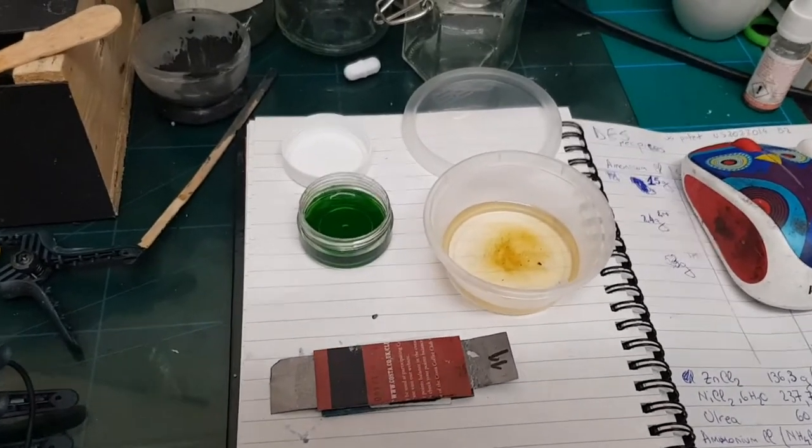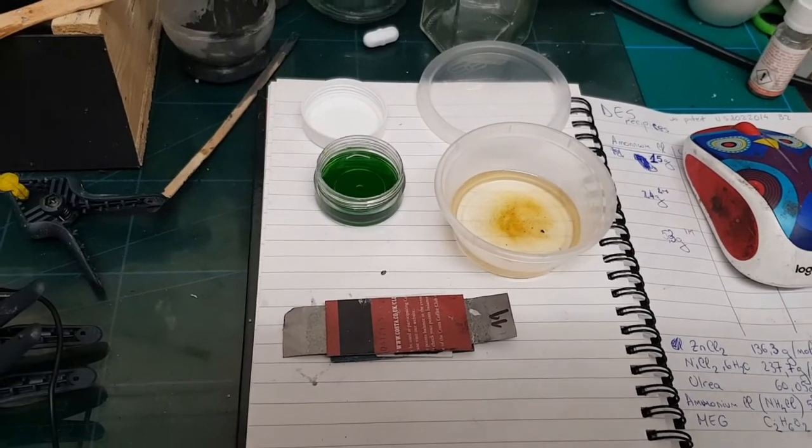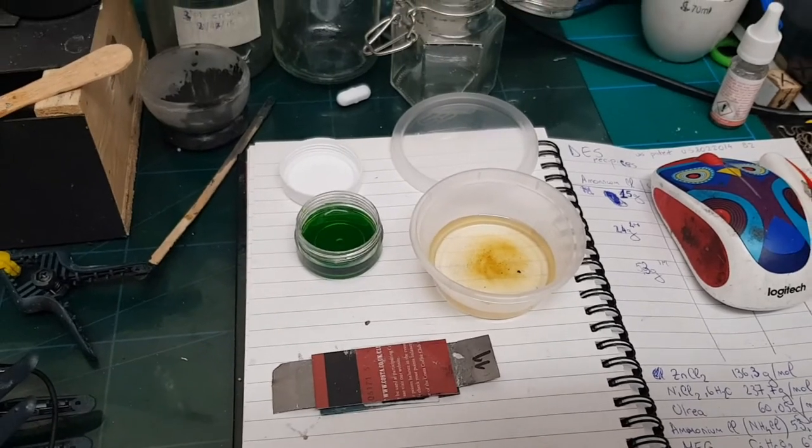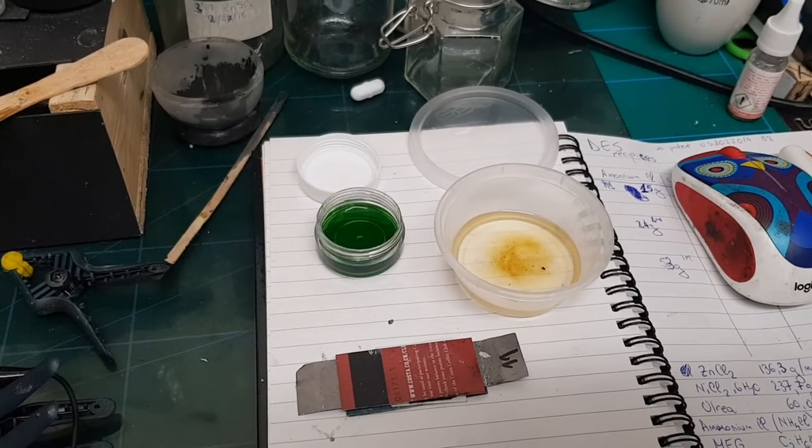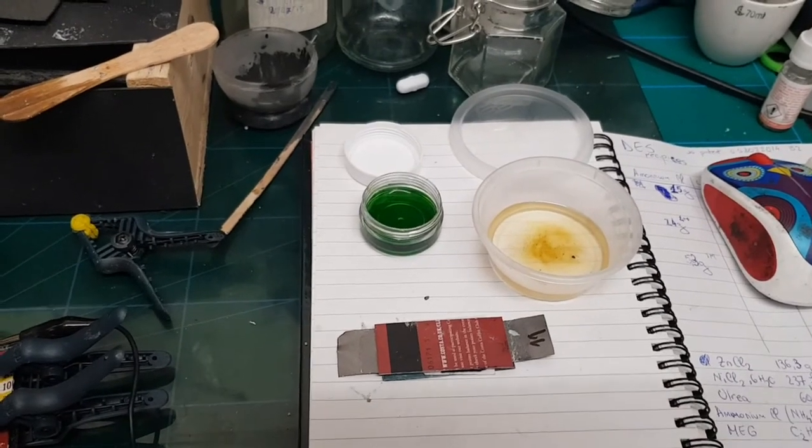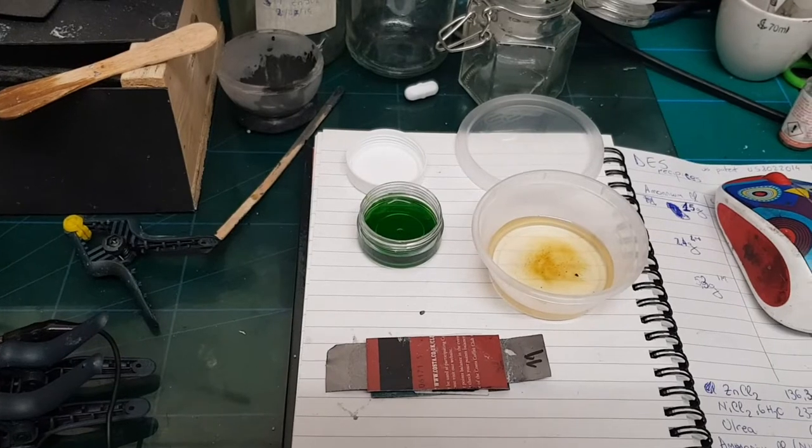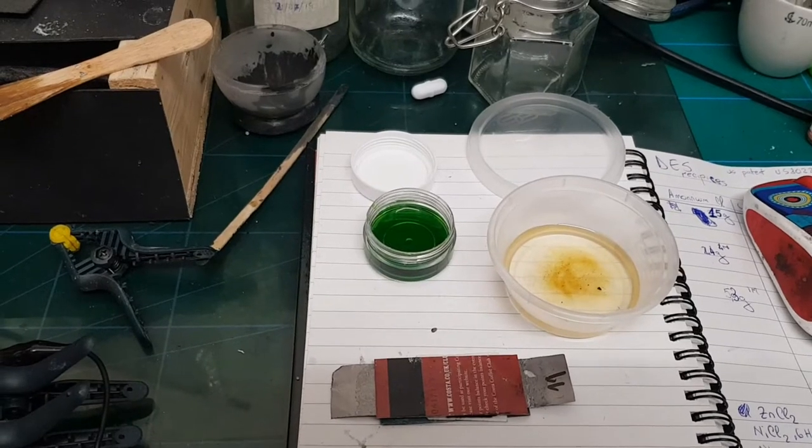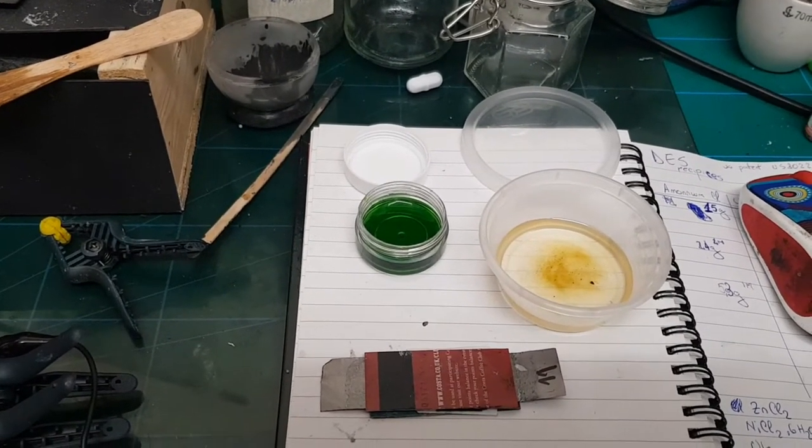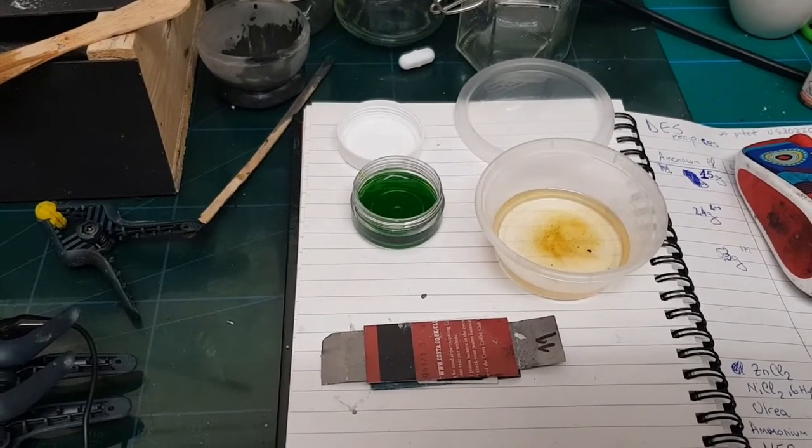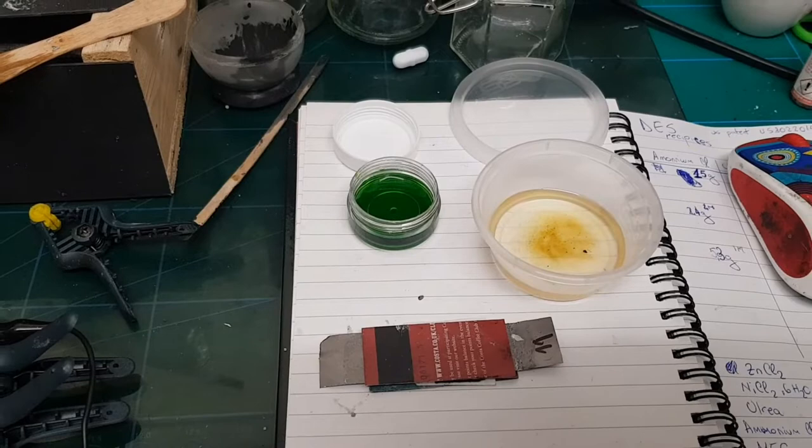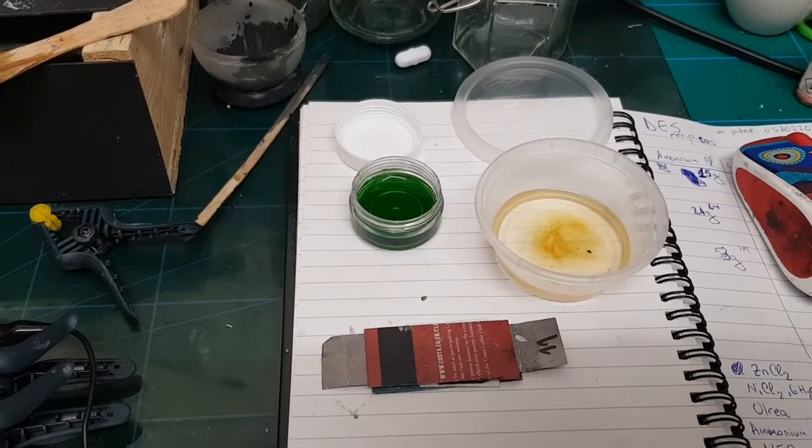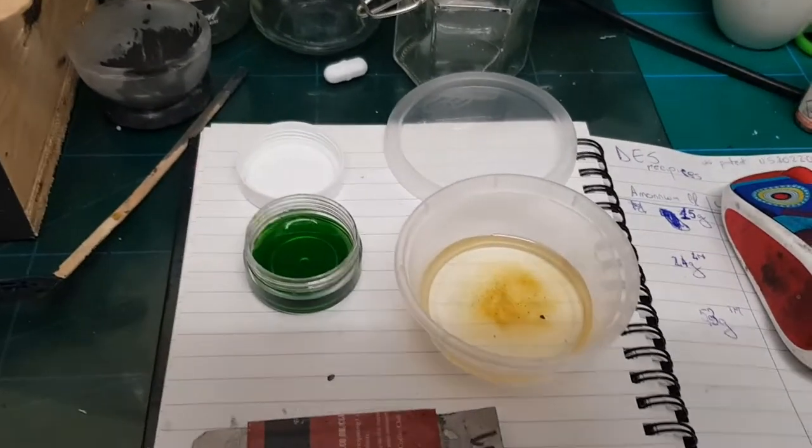Hello everyone, I'm back with a new video about deep eutectic solvents. I've been doing research based on other scientists' works and came up with a few recipes. I'm testing their properties in an all-carbon device - not exactly a supercapacitor or battery, but an all-carbon super device with symmetrical supercapacitor construction that's showing battery-like discharge behavior.